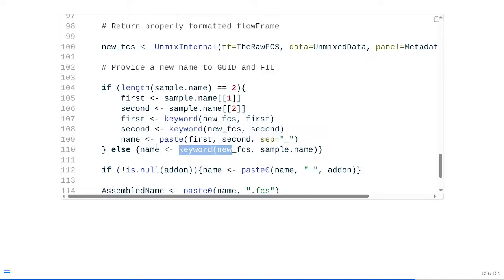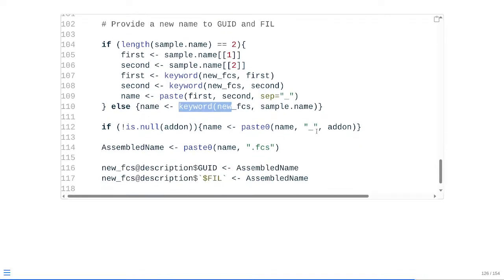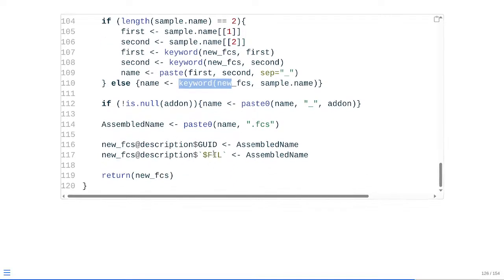Vice versa, if we provided two keywords that we want to use in the final unmixed file FCS name, it breaks that process into separate components and then just pastes them together, putting a little separator of the underscore at that point. Ultimately, regardless of which path is taken, you'll end up with a new name. This name is then appended on with the add-on so that way it's present as far as like the unmixed component. And then once this has been carried out, it will go ahead and add on the .fcs portion of the file name, and then it will just go ahead and overwrite within the keyword list the GUID and the FIL keywords respectively to match the new name that we're giving our new unmixed FCS file, so it's not wandering around with the old raw FCS file's name.